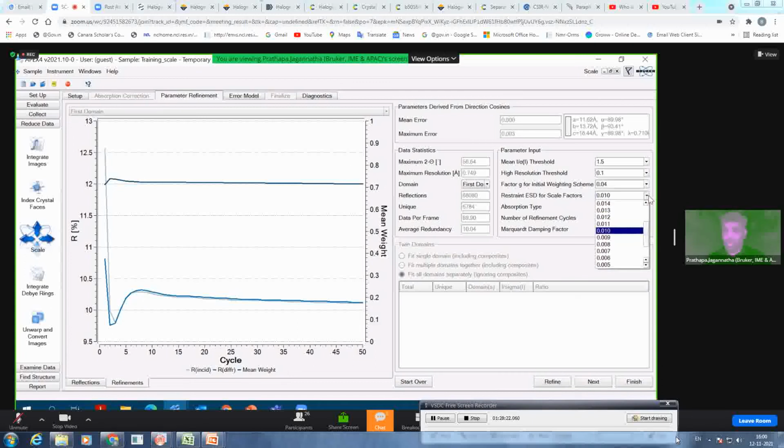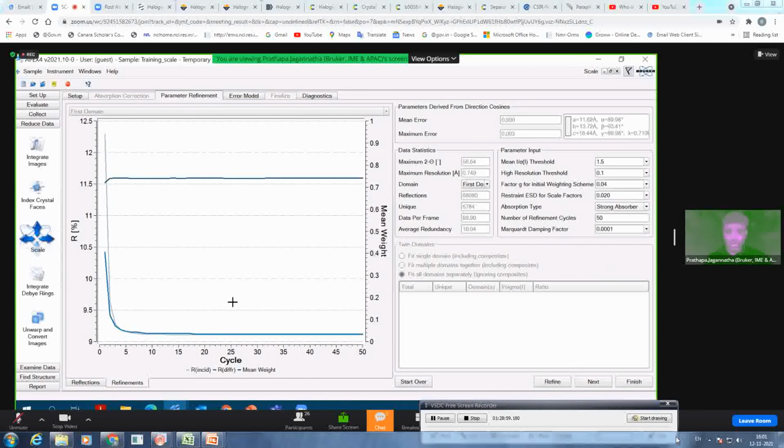So to improve, maybe I can go even further, restricting the ESD for scale factor up to 0.02 and refine again and see whether I can improve or not. I kept it as a strong absorber because this crystal looks like a very strong absorbing and very anisotropic crystal. Okay, now it's looking better. It is much more smooth. After only 4 cycles it converged, and you can see the mean weight is also slightly improved.